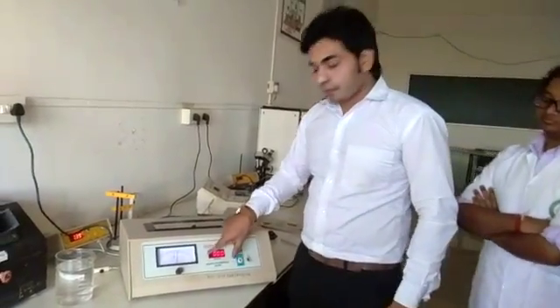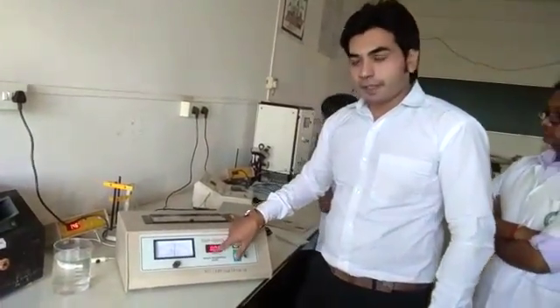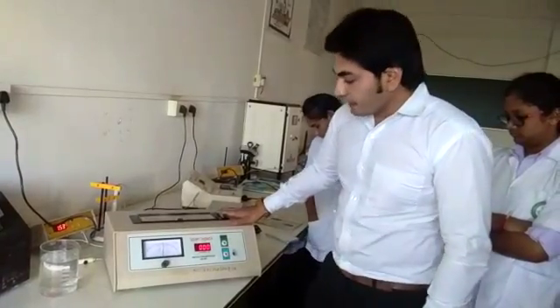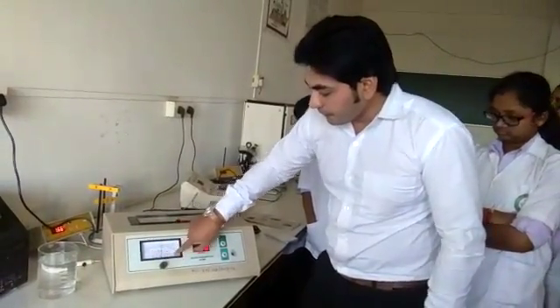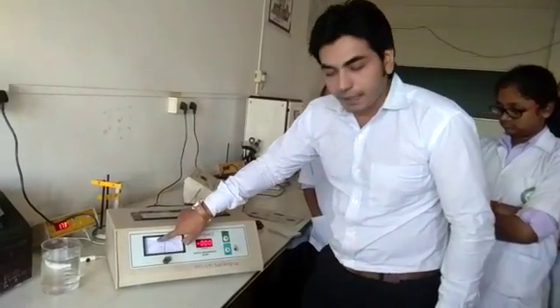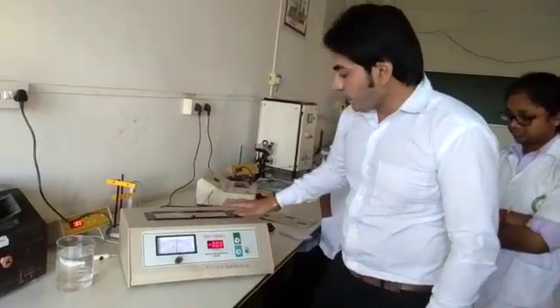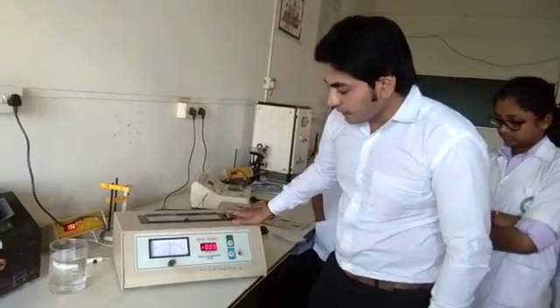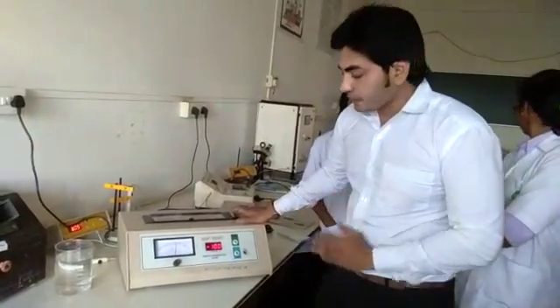You can see on the display board there is a zero reading. Now rotate the polarizer wheel towards the intensity meter. This side is called the maximum and this side is called the minimum. Rotate the polarizer wheel in such a fashion that the intensity moves towards the maximum side first.